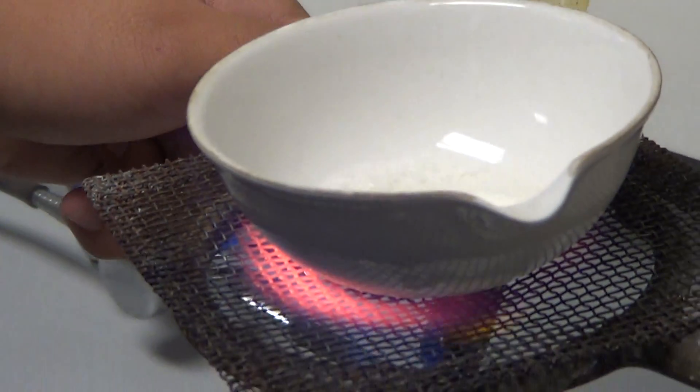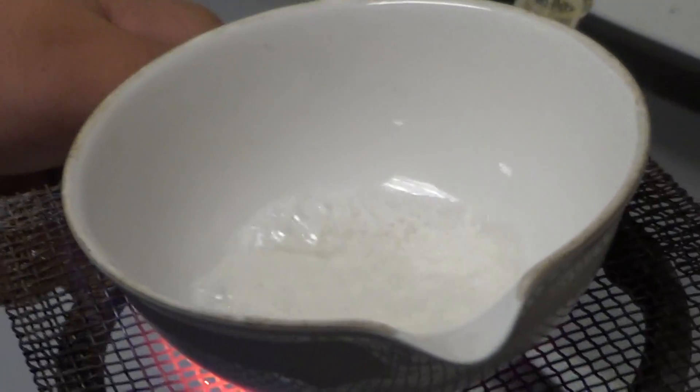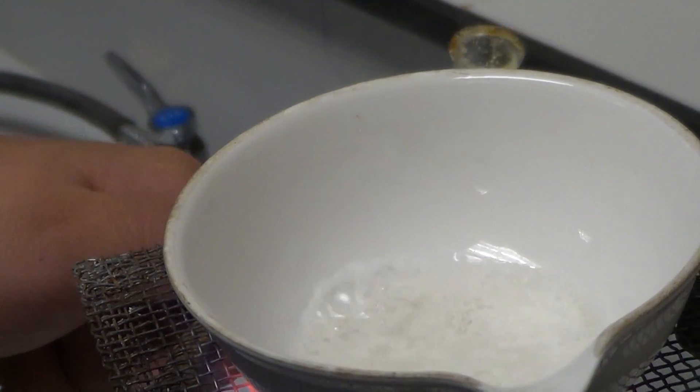Look, it's evaporating. Not like the name suggests anything. Like, evaporating dish.